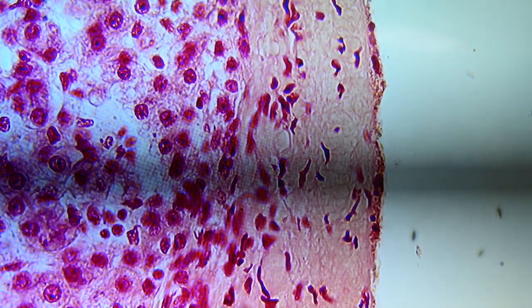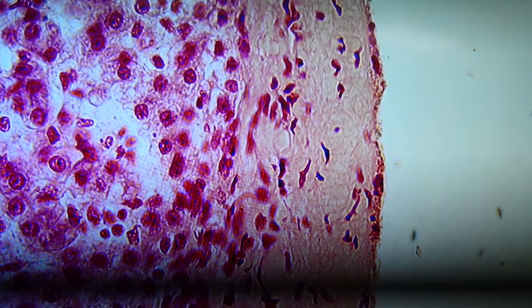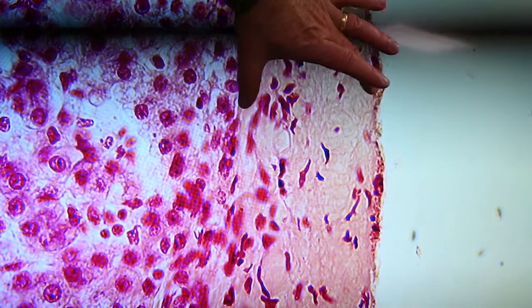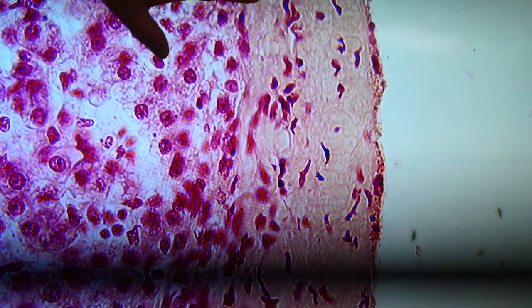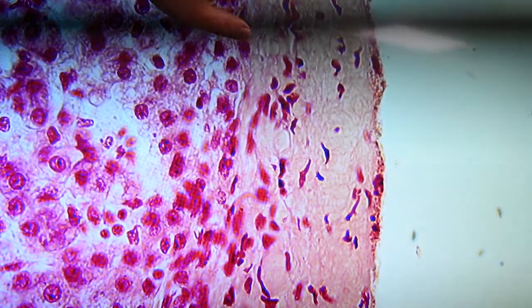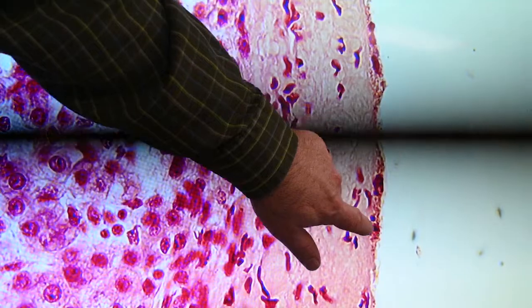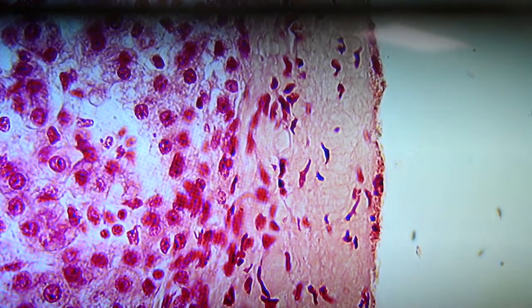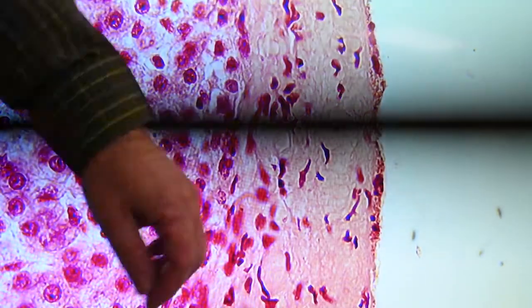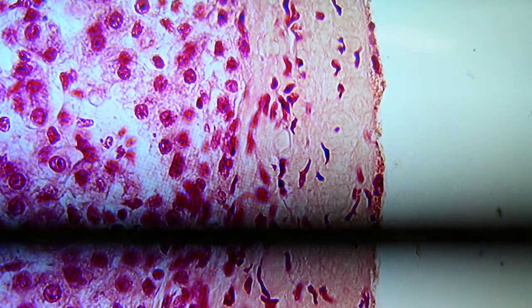Here we are looking at our first slide showing part of Glisson's capsule on the outside of the liver. So we have a section over here that's all collagen. This is all hepatocytes and liver tissue here. This section through here is all collagen, and these cells through here, especially these dark narrow nuclei, these would be fibroblast nuclei. And on the very outside we have some nuclei here. These would be those simple squamous cells of the mesothelium, the mesothelial layer on the outside of the liver. All that together makes up Glisson's capsule. So there's our first view of Glisson's capsule. Now bring up another picture of Glisson's capsule.